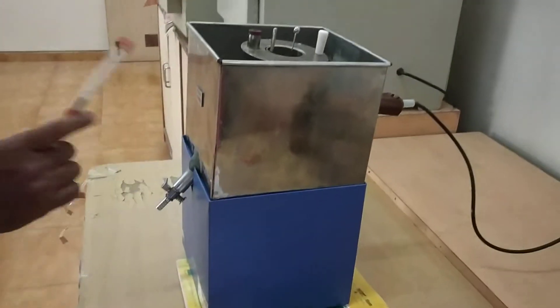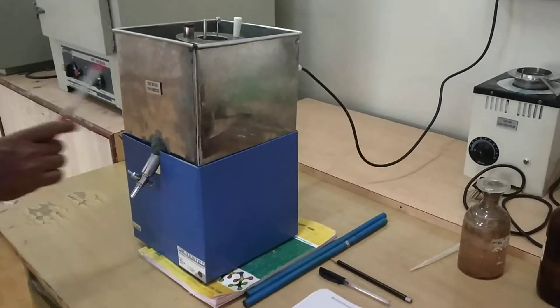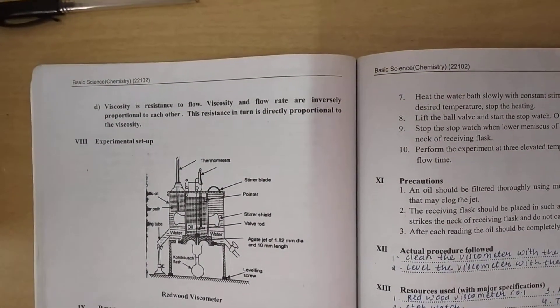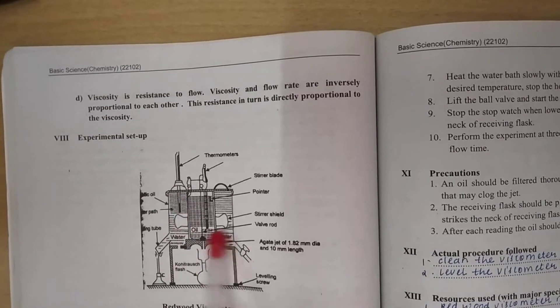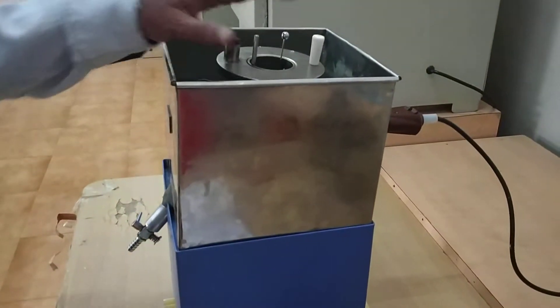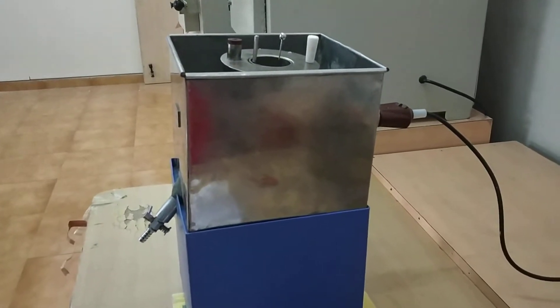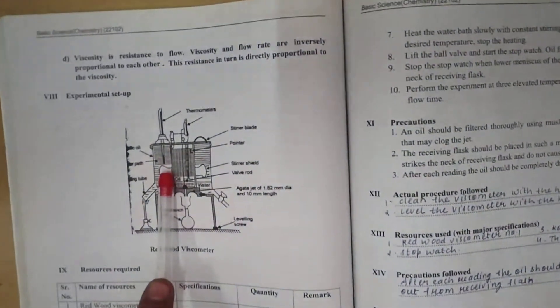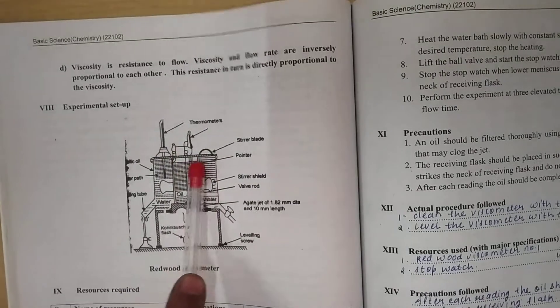This is our Redwood Viscometer. By this Redwood Viscometer, we should understand the study of viscosity. In this viscometer, the outer jacket is there in which water gets filled. Then there is one small cup in which oil is filled. In the water, one thermometer is to be dipped, and in the oil cup, one thermometer is to be dipped. These two thermometers are required for these experiments.